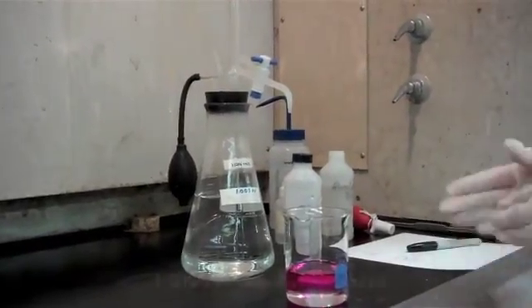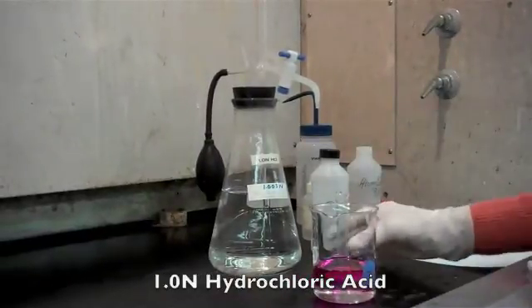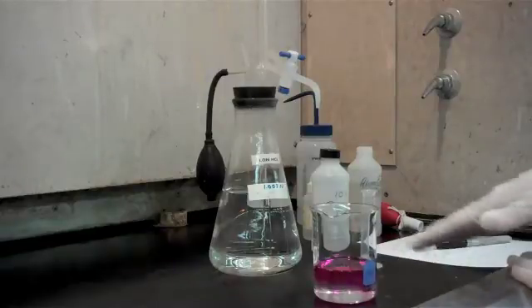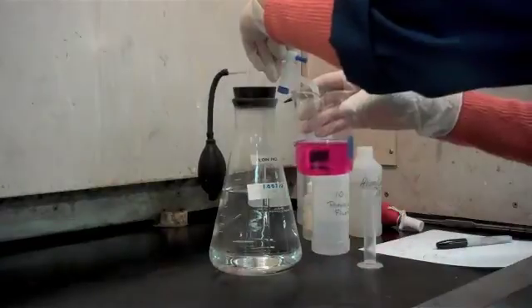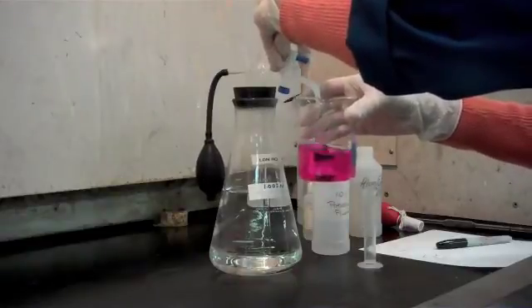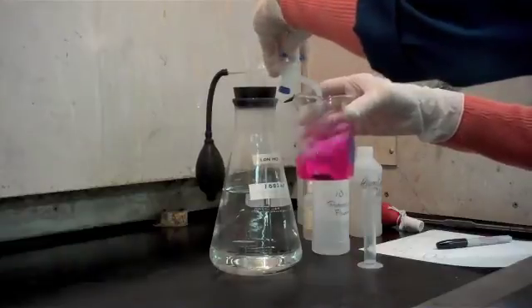We're going to titrate from pink to colorless using one normal hydrochloric acid. So we're going to add the hydrochloric acid slowly, swirling our sample until that pink color disappears. And what I usually do is add a little bit of hydrochloric acid, swirl, and stop so we don't go past our endpoint.